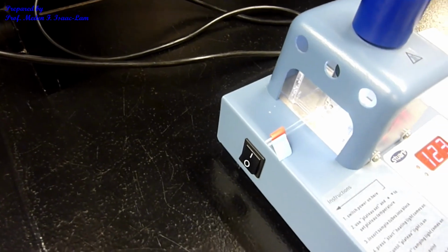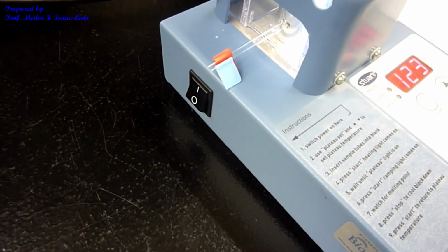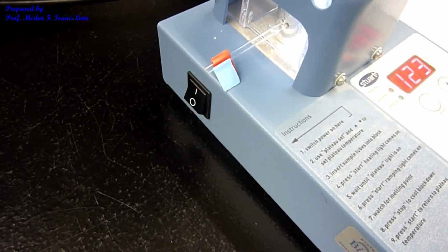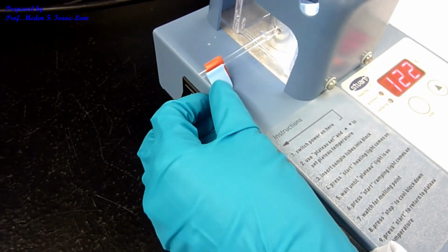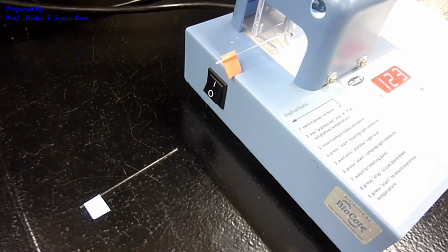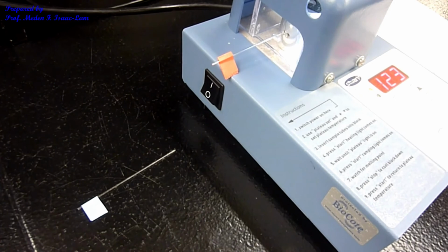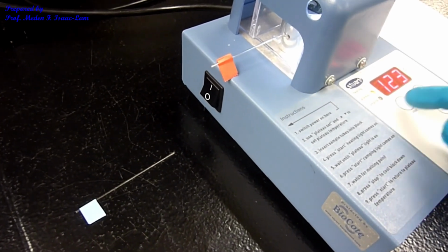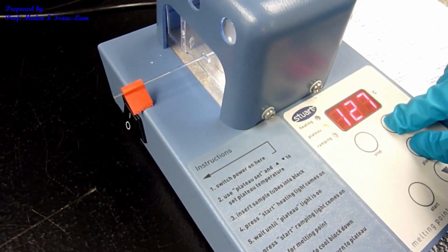So it looks like the carboxylic acid melted at this temperature. So it's about 122 to 123 for this sample for unknown number 4. That means that I can take out the blue one. It already melted. So if you look at the data in the PowerPoint, the next melting point is 159. Now I'm going to stop it and then plateau again to 159.